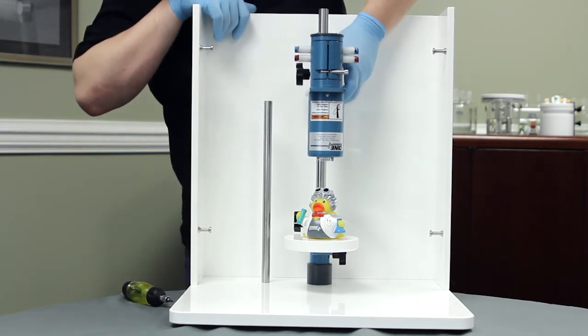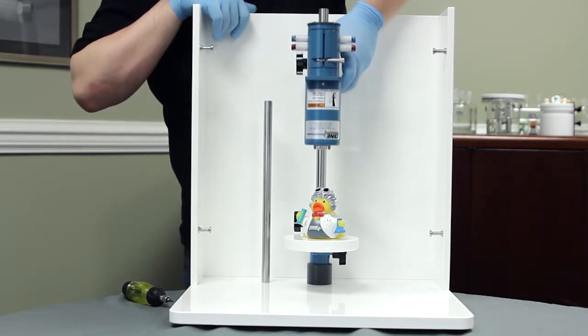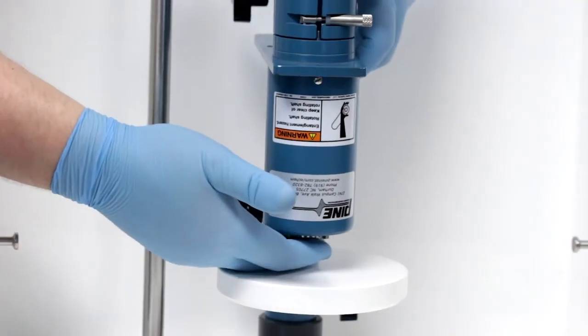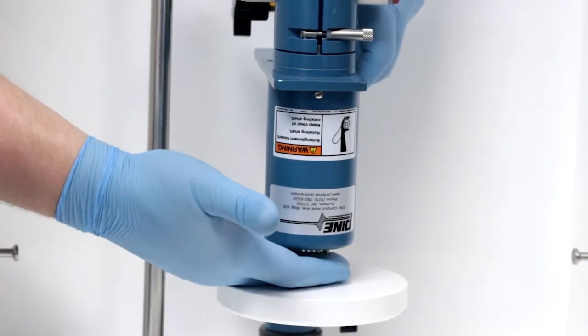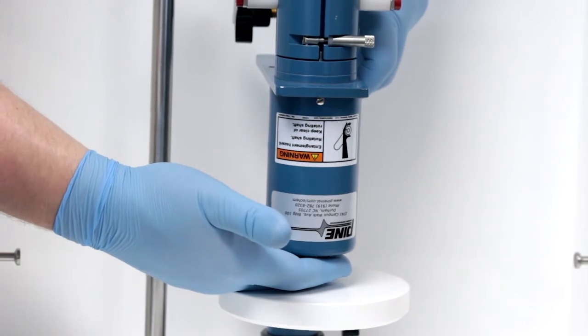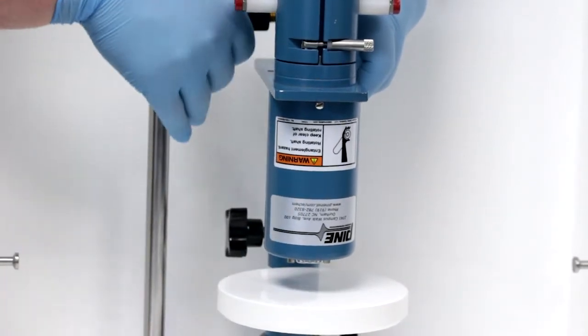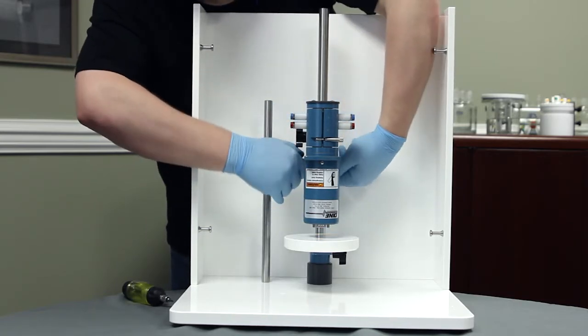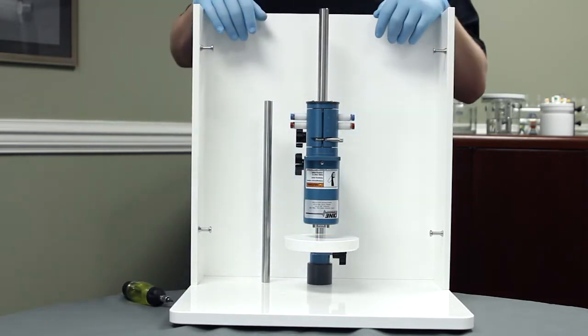Could you, thank you. Slide this unit down here and I'm going to place my hand here so that the unit stops in my hand so I have the perfect set height here and move our collar up to keep it in place. Perfect.